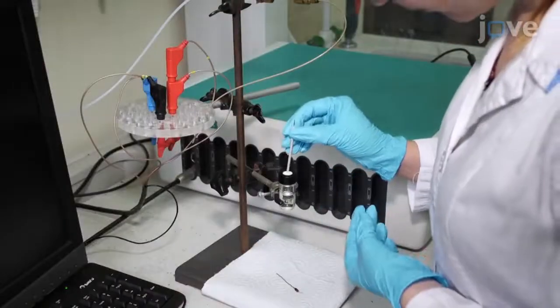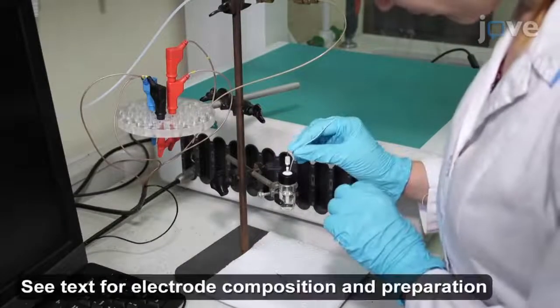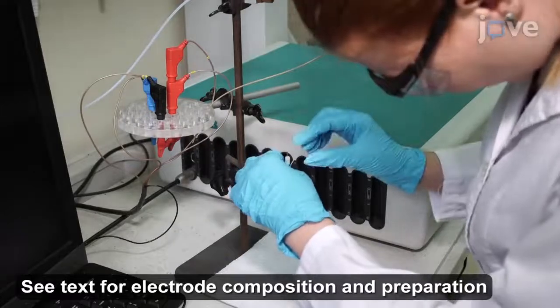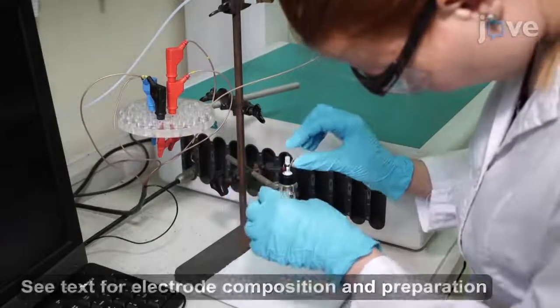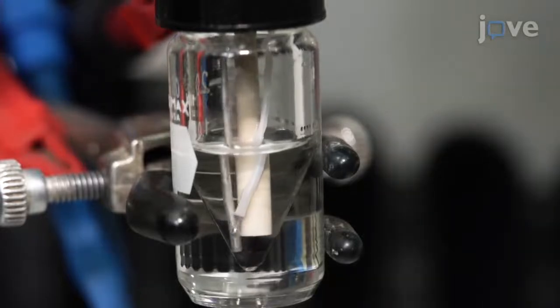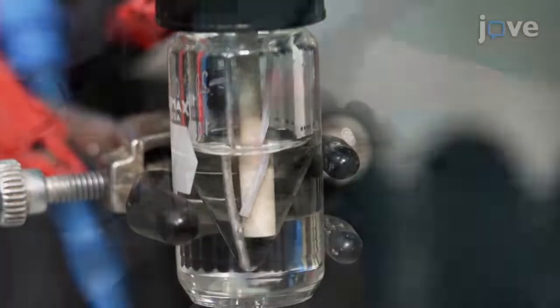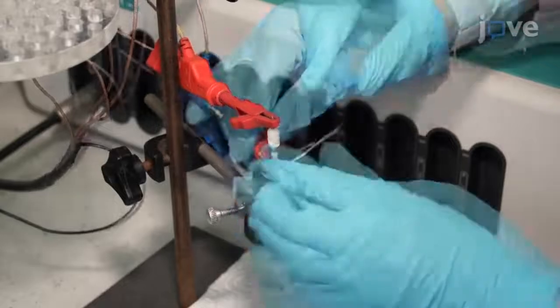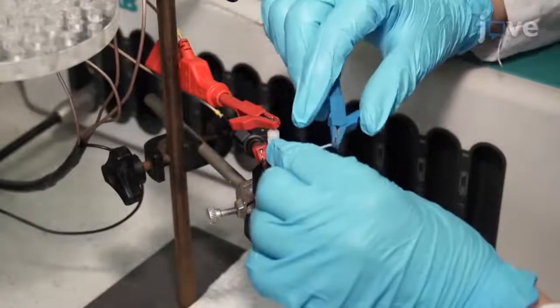Insert working, auxiliary, and reference electrodes into the cap, with the working and reference electrodes as close together as possible without touching. Ensure that the electrodes are immersed in the electrolyte. Then connect the electrodes to a potentiostat, being careful not to let the connectors touch each other.